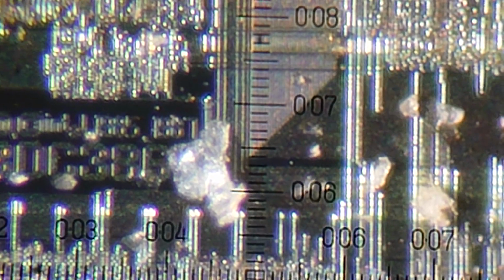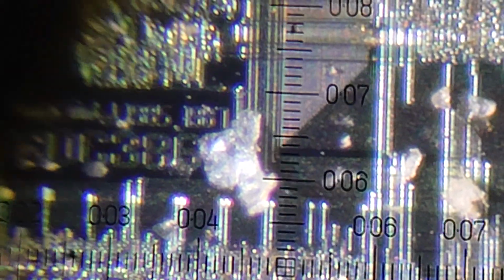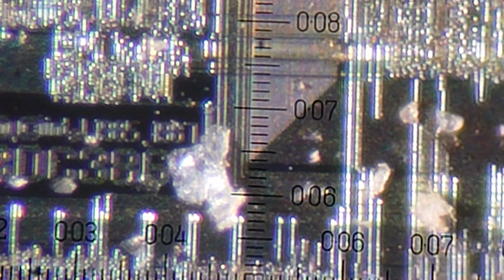and when we use the zoom, it's not properly working so far. It's losing focus a bit. It's just normal. It's still not done. It still hasn't been maintained properly. And that was our left channel.